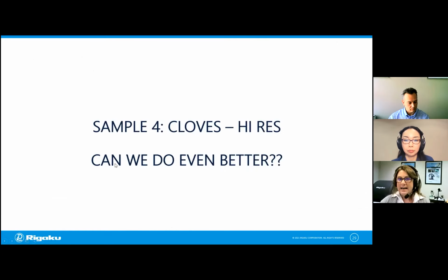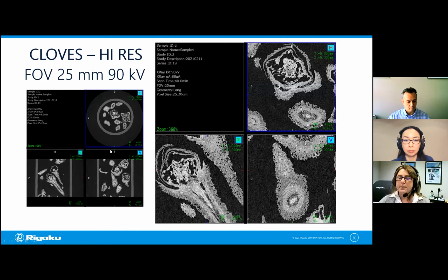And it turns out we can. These are just quick scans to determine how we should collect the data. If I instead collected this with a 25 millimeter field of view and used an applied voltage of 90 kV and a small focus and collected a little longer, then I pick up some other details. And if I'm still not happy with that, I might optimize some more settings before I go on.